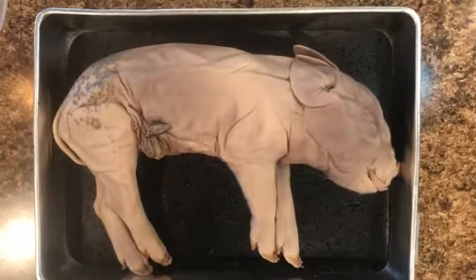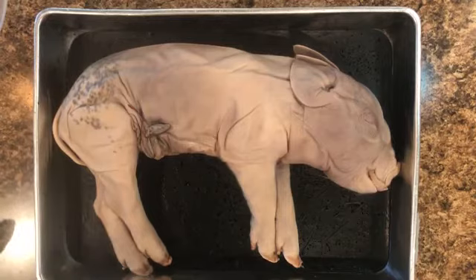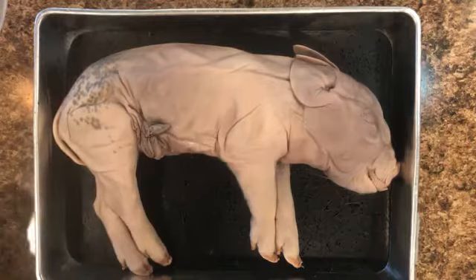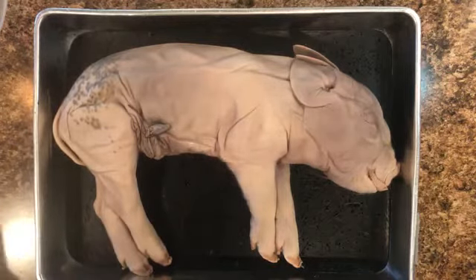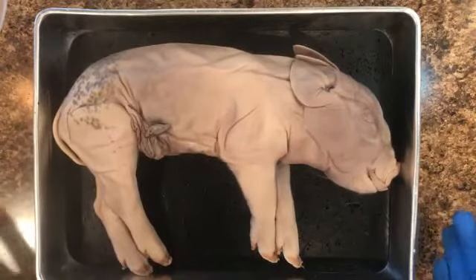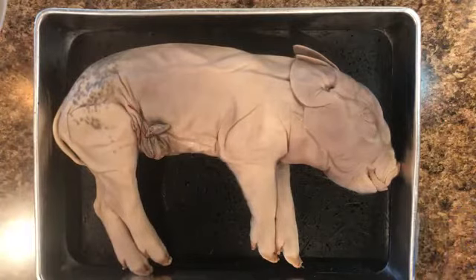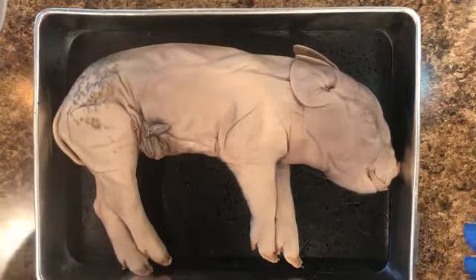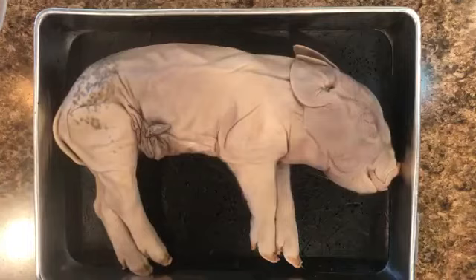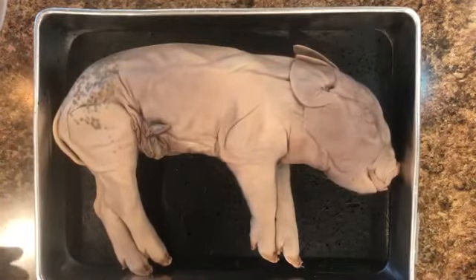Also, we dissect to understand the complexity and the interconnections among the parts of an organism that processes energy. We also want to observe the variation among specimens in placement, color, and things like that of their different structures. If we were in the classroom setting, you would all take a look at everyone else's fetal pigs, because believe it or not, they do look very different from one another. Similar, but also very different, especially from a male to a female. That way you could observe the differences in the reproductive structures.